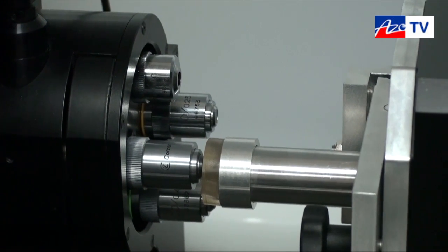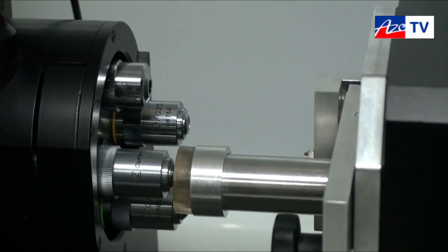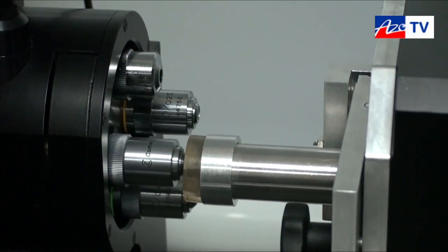In this case what we do is we perform a grid over the cross-section of the solder, inter-metallic layer and copper in order to look at the gradient of properties through those different materials.